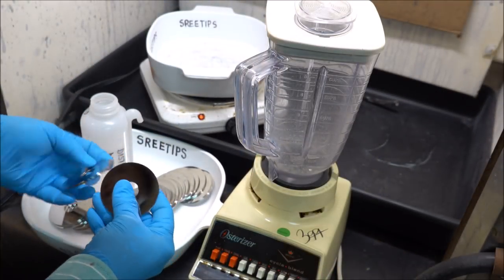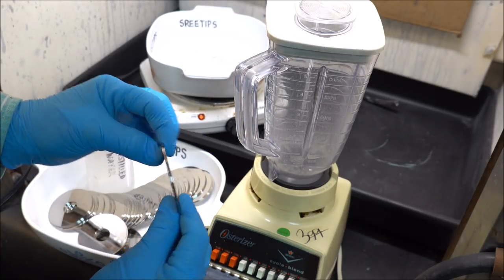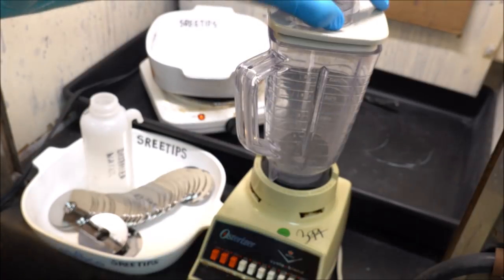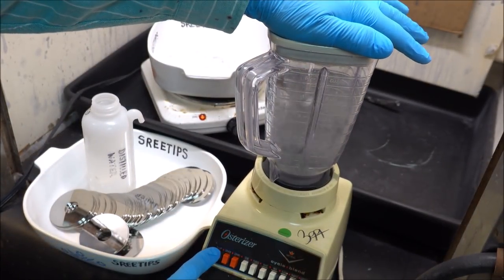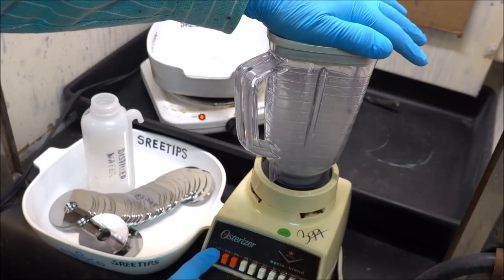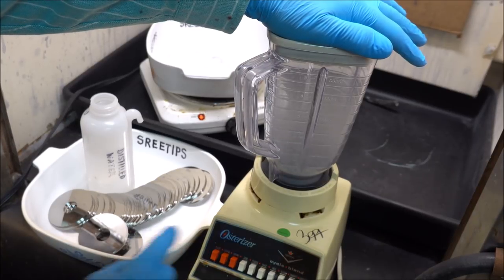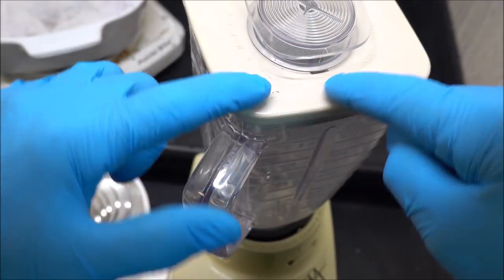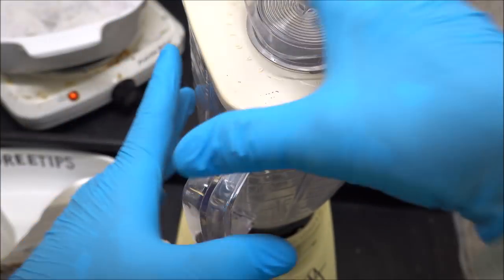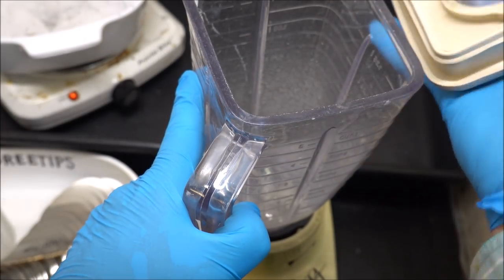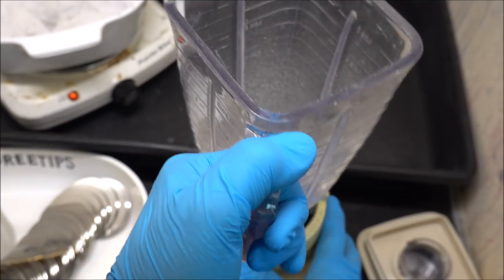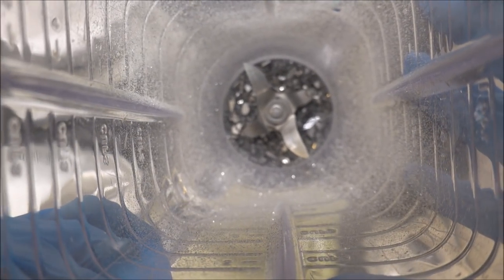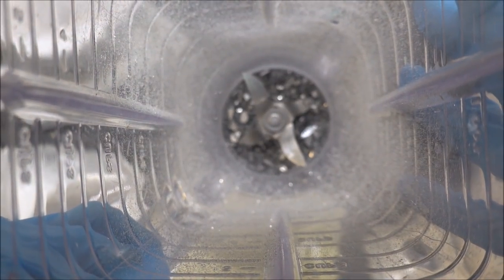I'm going to put two or three in at once here, that's three stacked together. I'm getting a little bit of glass fragments coming out of some holes here in the top of the lid. That's powdered glass, so you don't want to be breathing any of this stuff.